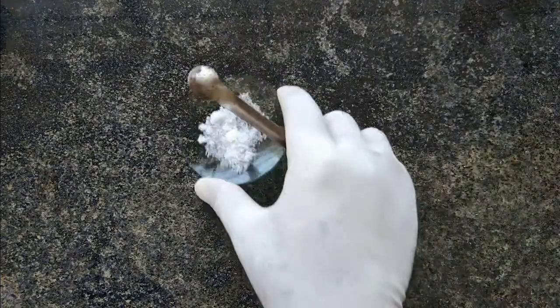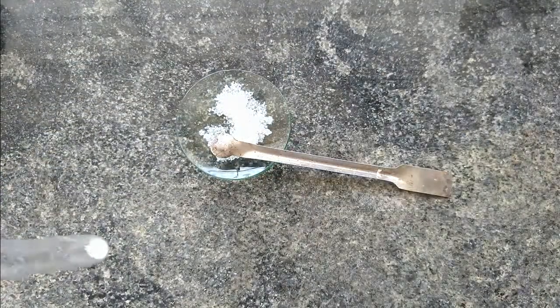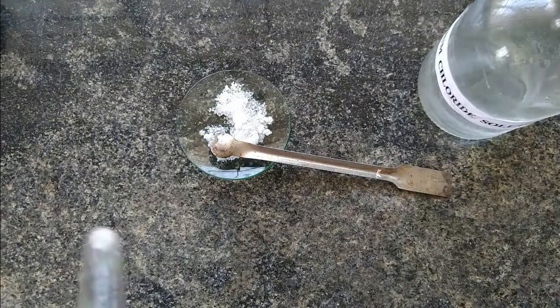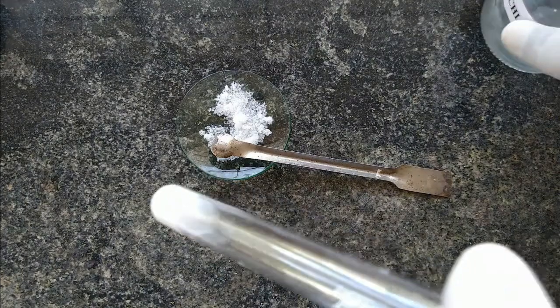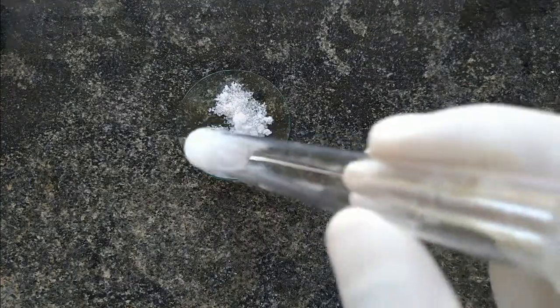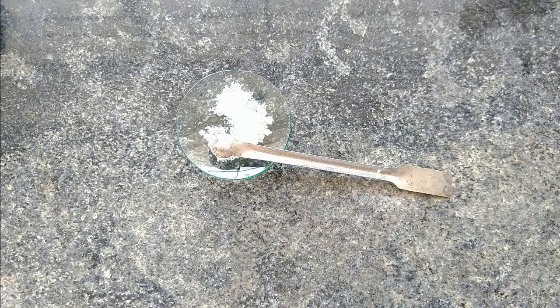Because group two is absent, we go for group three — analysis of group three. The test we are going to conduct is the test for sulphate: salt plus barium chloride solution. I am taking the salt in the test tube and adding barium chloride solution. After adding barium chloride, the observation we are getting is a white precipitate, which gives the inference that group three is present — that is, sulphate ion is present. So we will go for the confirmatory test for sulphate.